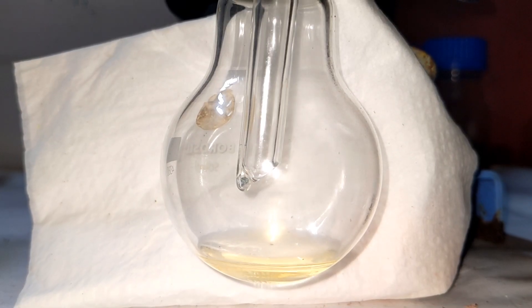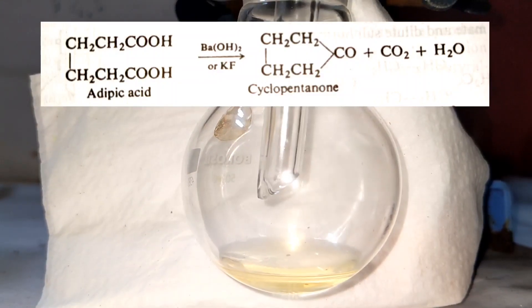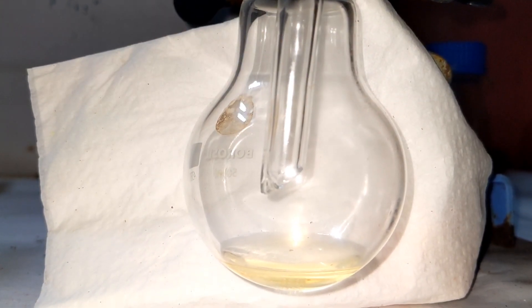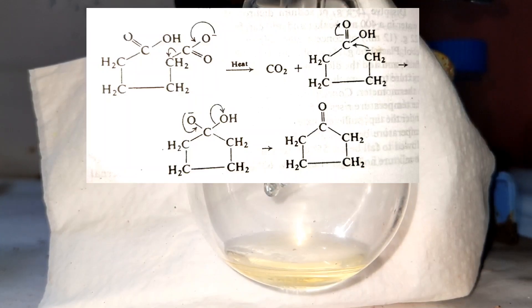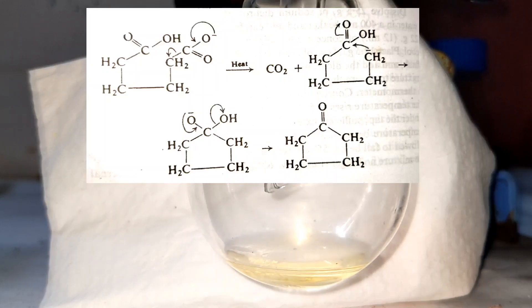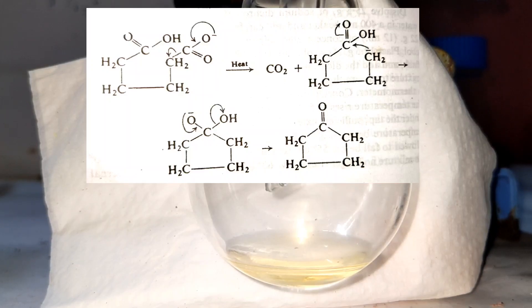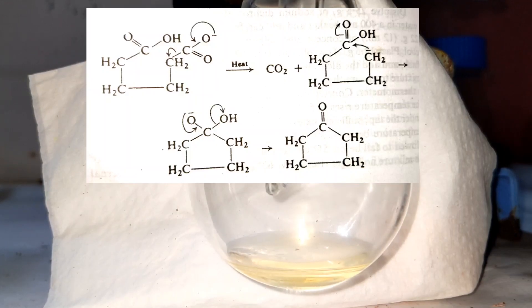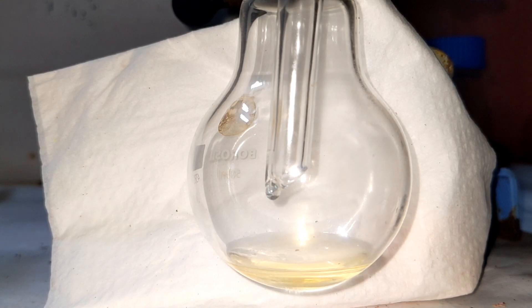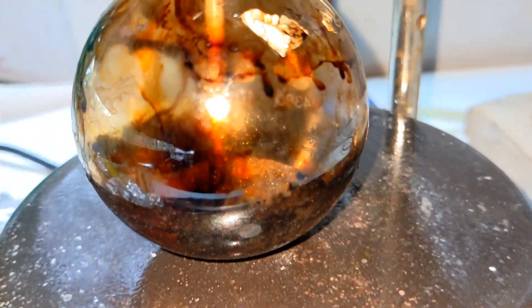While it distills over, let us look at the reaction. The proposed mechanism involves initial formation of a monocarboxylate ion by nucleophilic reaction with a hydroxide ion, followed by decarboxylation at elevated temperatures to yield a carbanion, which is preferentially cyclized to form an enolate ion. Elimination of the hydroxyl ion and its combination with the abstracted proton results in formation of a water molecule and the product.